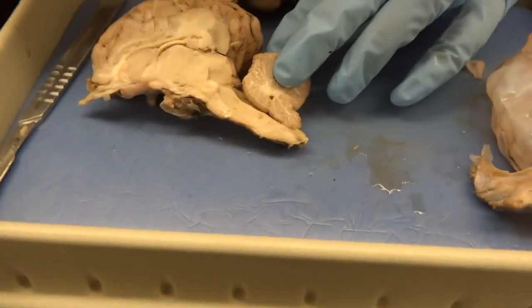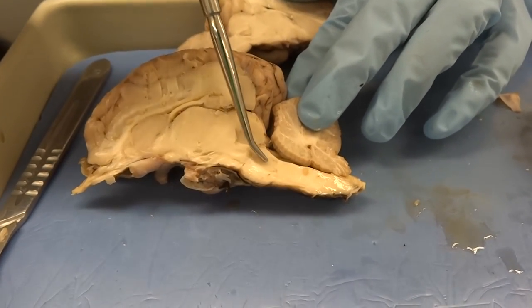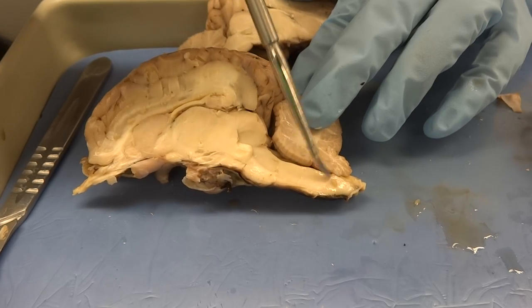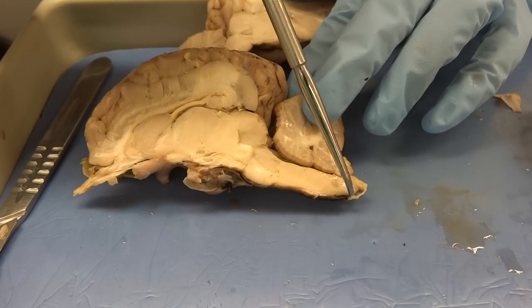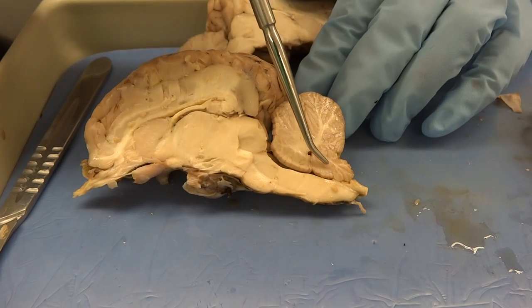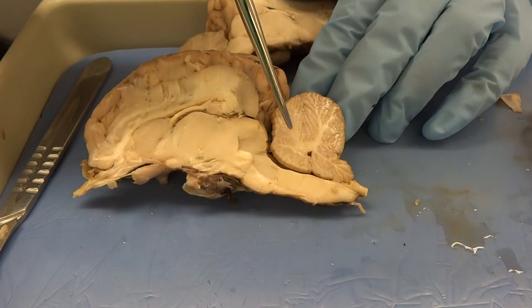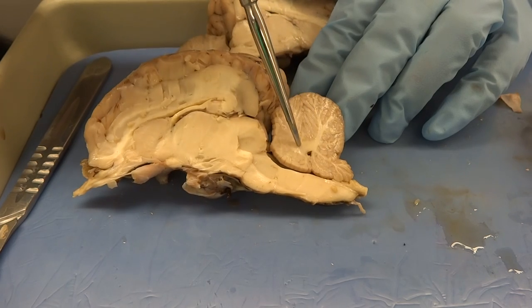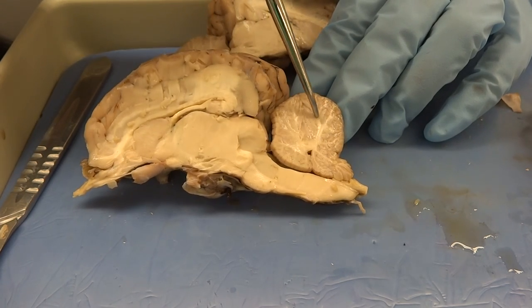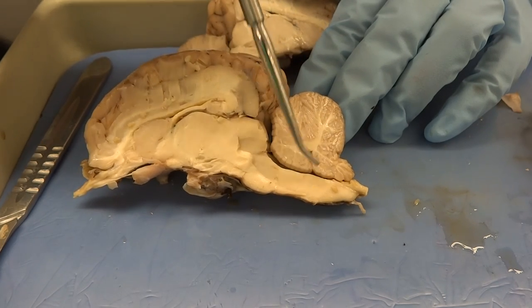Then we have our pons and the medulla oblongata, which gives rise to the spinal cord as it moves down out of the skull. From this angle you can also see the white and gray matter really well in our cerebellum — the white matter is the Arbor Vitae, and the gray matter is the cerebellar cortex.